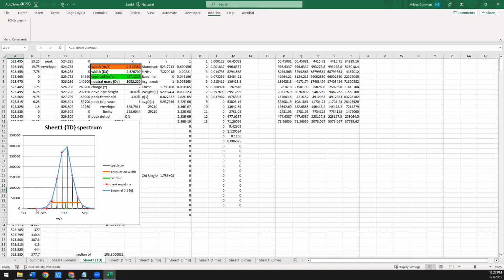So this is the fully deuterated spectra. This blue fit is still fitting pretty well. And in this case, it's using 7.2 as the number of amides to achieve the correct width to fit well to the isotopic distribution. So the fully deuterated reference is actually a really good tool to have, or a good sample to have, because you can use that as a gauge for what kind of number do I actually expect for the number of amides for a pure population, because this is fully deuterated, it shouldn't contain subpopulations.